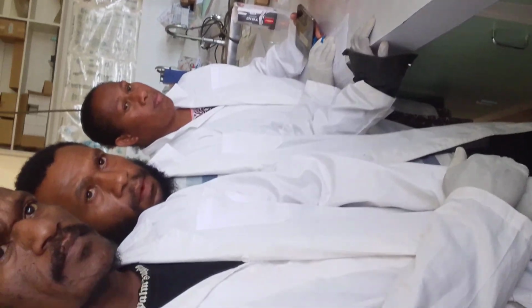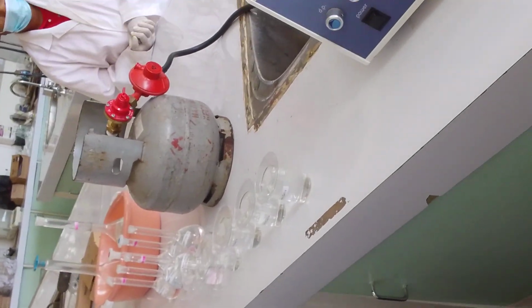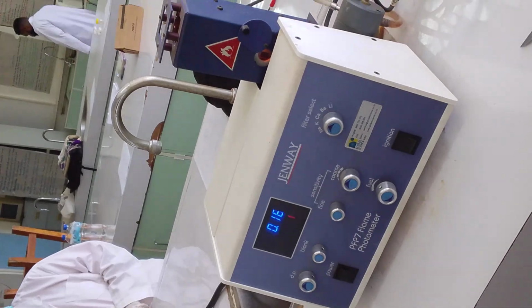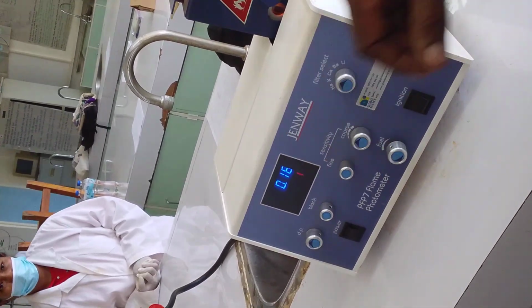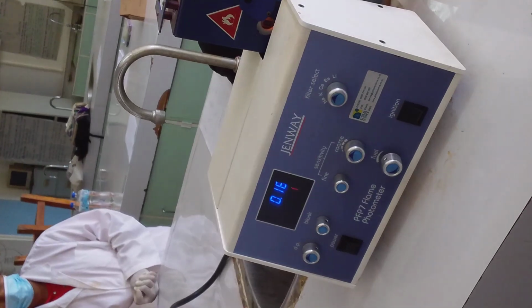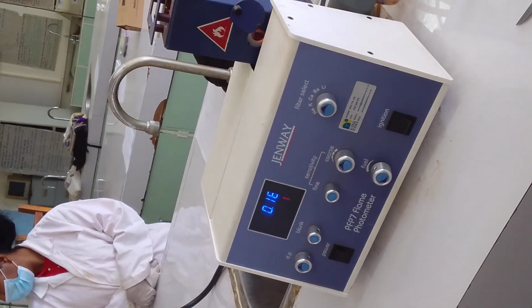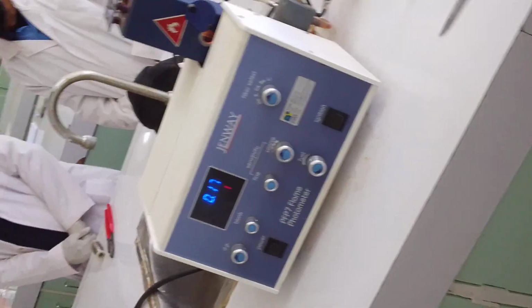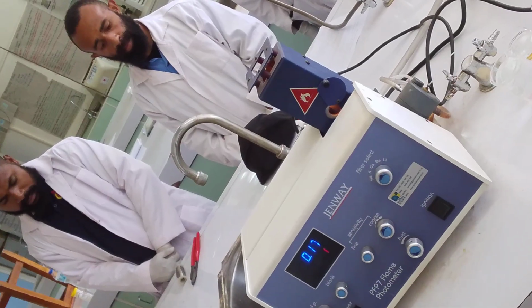Like if you don't have water and you use Coca-Cola to add your sample in, and you make up your sample to determine calcium, then you can use that as your blank. You put in Coca-Cola, then you zero your reading. And then when you put your sample in, it gives you what you expect. A flame photometer. What else?